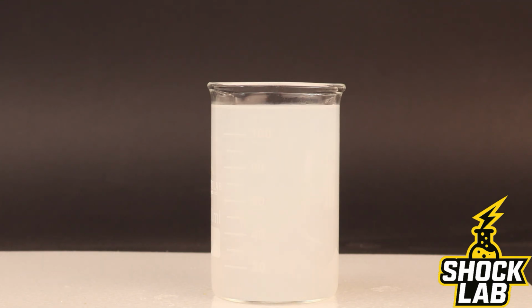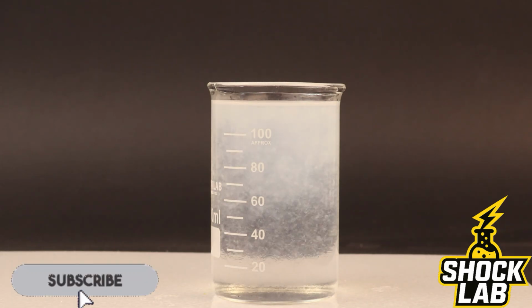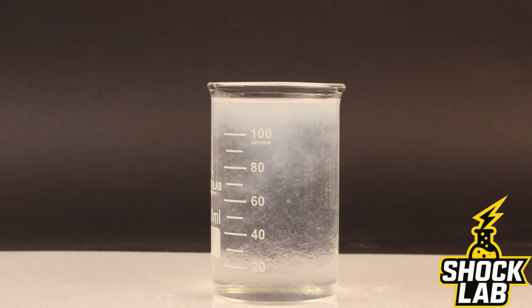Now comes the interesting part. Hydrochloric acid is added slowly to the cloudy mixture. As the acid reacts with the aluminum hydroxide, the white precipitate gradually begins to dissolve. Little by little, the solution loses its cloudy appearance and becomes clear again.